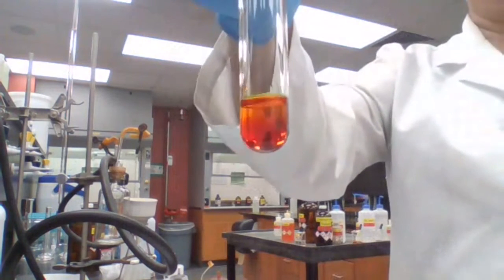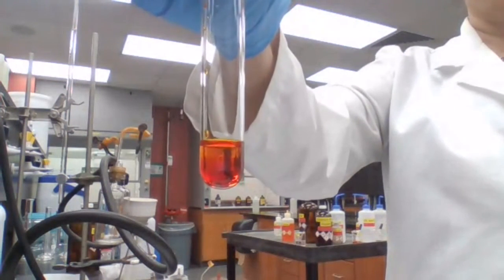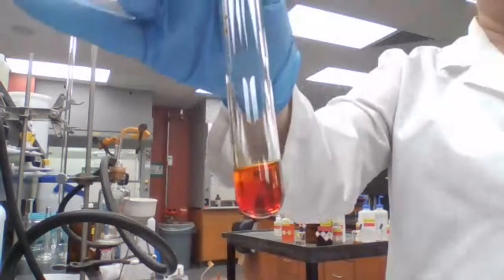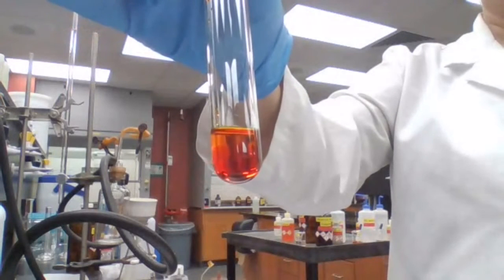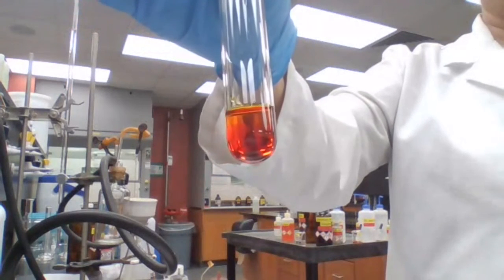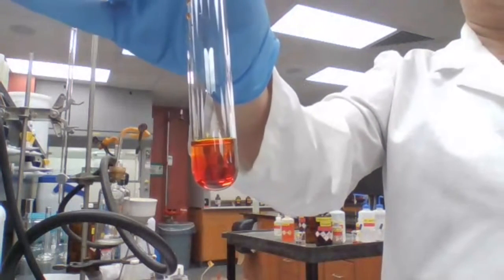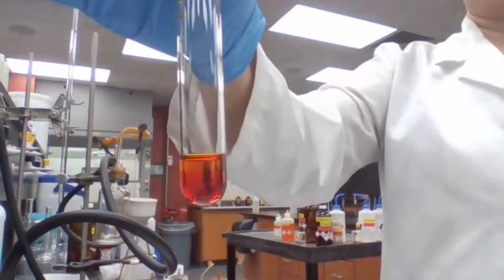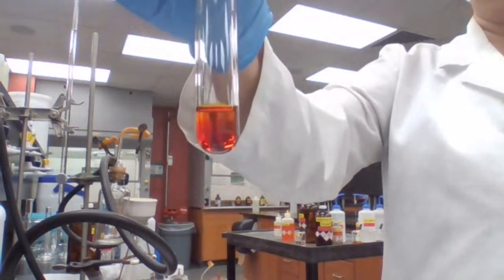Record your observation for the chromic acid test. Okay, if you are group unknown B, did you record the observation?